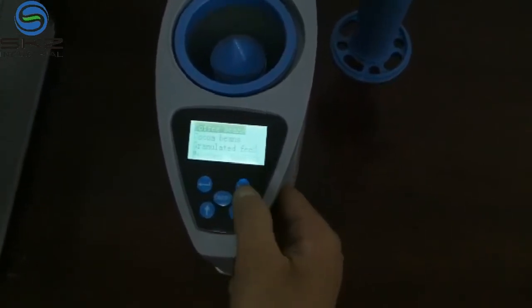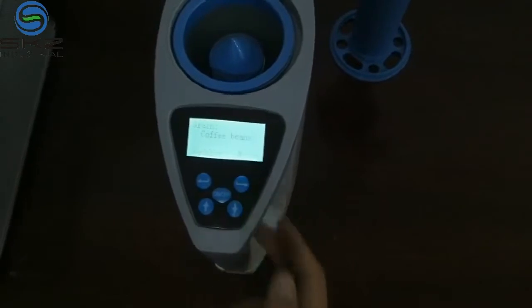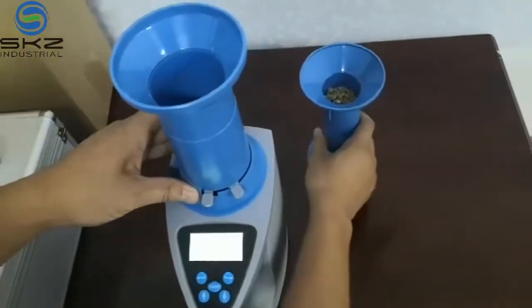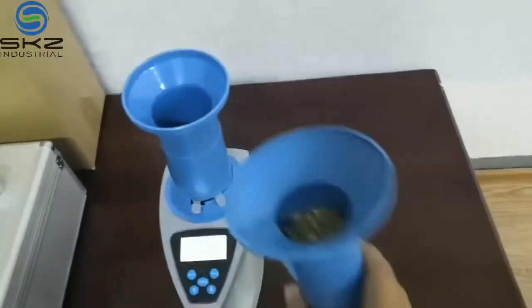Now we've selected coffee bean. Press confirm. This is the drop barrel. Put it in place, then put the sample inside.